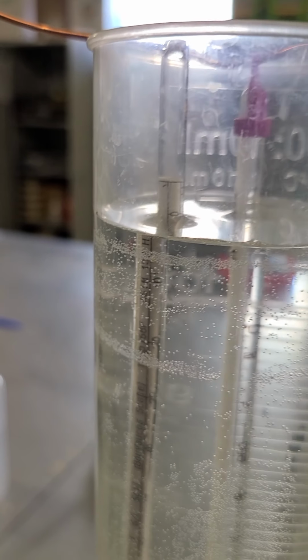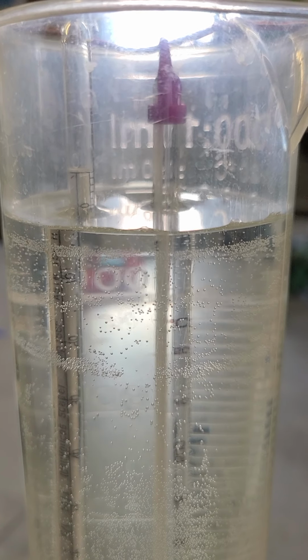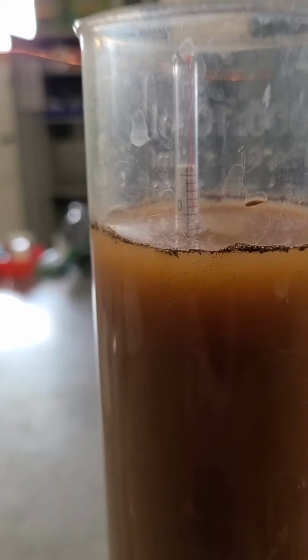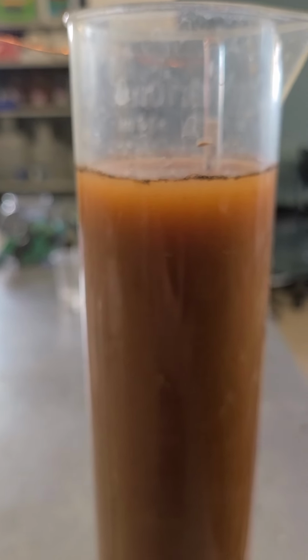So what we would do on this one is we would actually put the actual reading of this. We'd put like a 2 for the blank and a 0 for the other one, and then over here we've got something that's, we didn't really give the first one, but we've got a reading that's about 3 or 4 on this one as well. So this is the way you would actually do this.